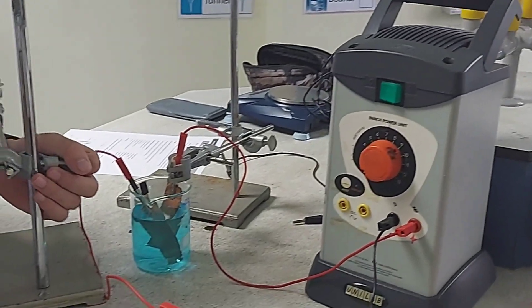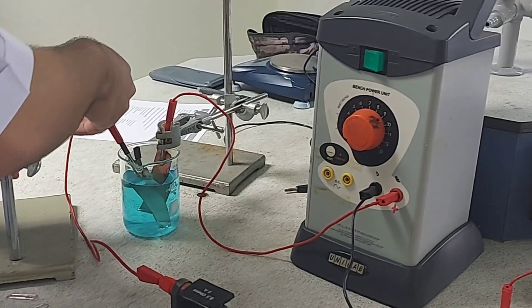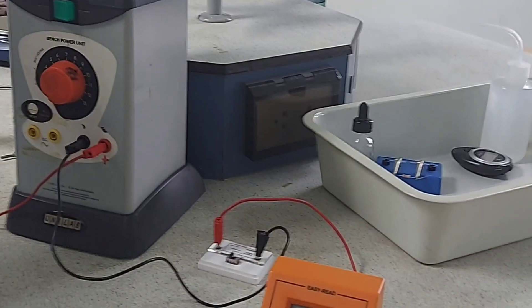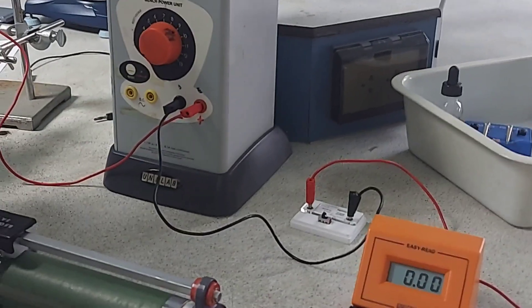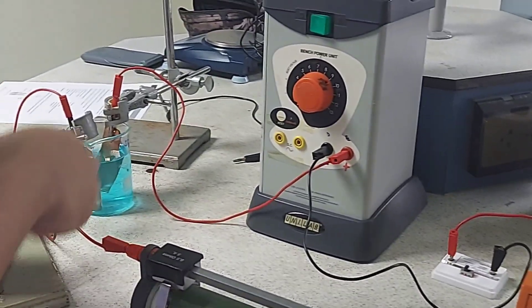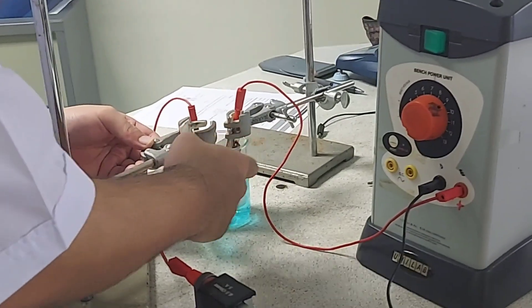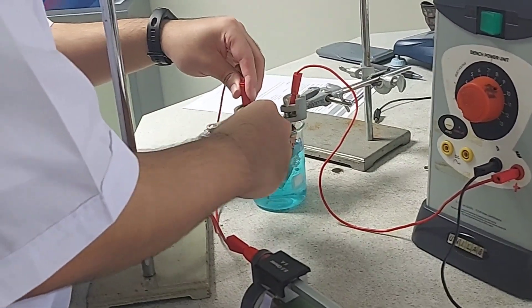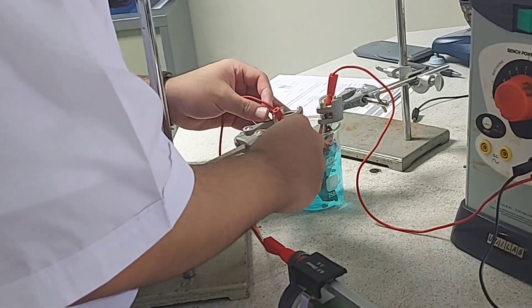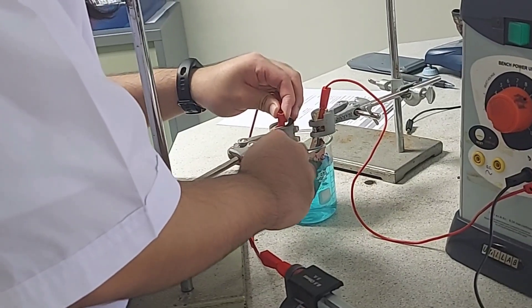You will notice that as the electrolysis process continues for 40 minutes, there will be a black deposit on the copper cathode. We are measuring the mass of the anode, and after the experiment we again take the mass of the anode to measure the loss in mass.